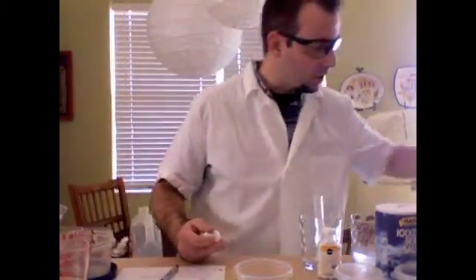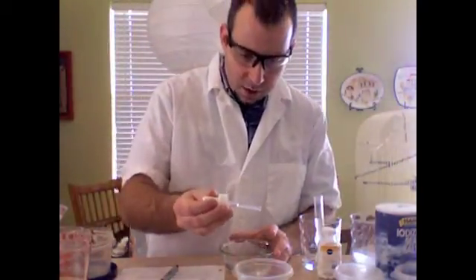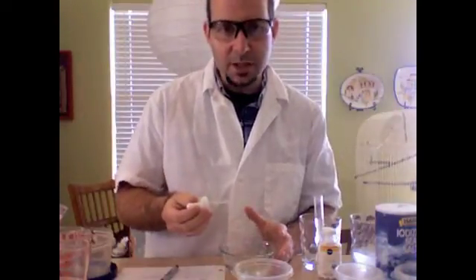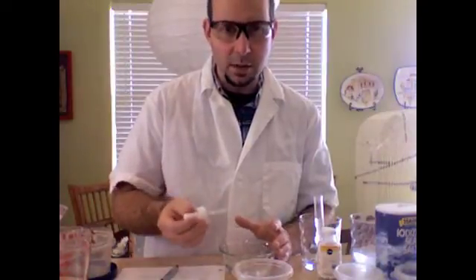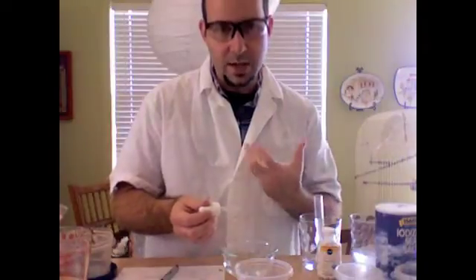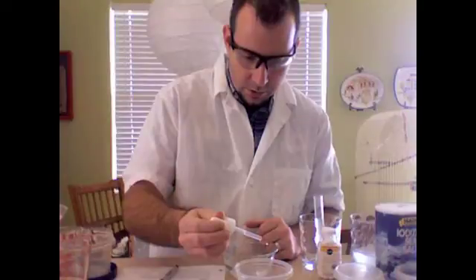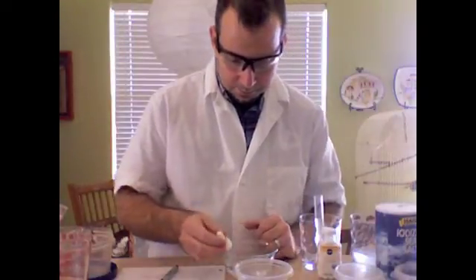So the first solution we're going to use is water, which is really not a solution, it's just a compound. And this is filtered water, so if you use water from your tap, you will probably find that it's basic because it's got chlorine in it, and chlorine makes complicated compounds in water, and those compounds are bases. So I'm going to add 5 to 10 drops. There's 1, 2, 3, 4, 5, 6, 7, 8, 9, 10.